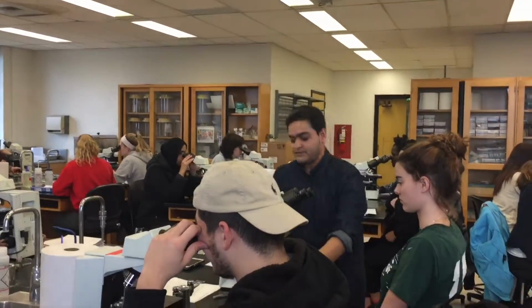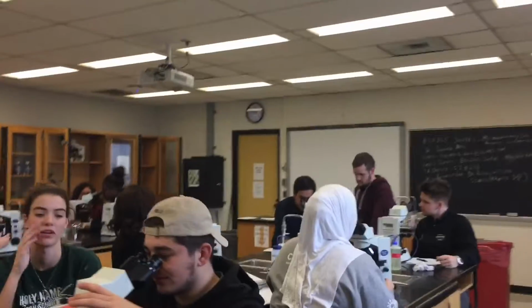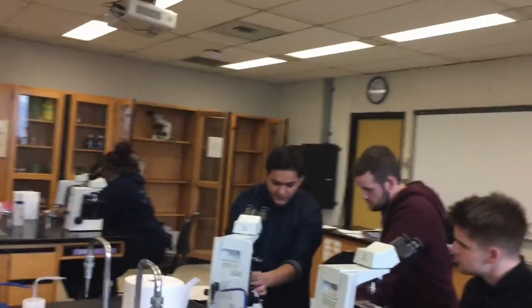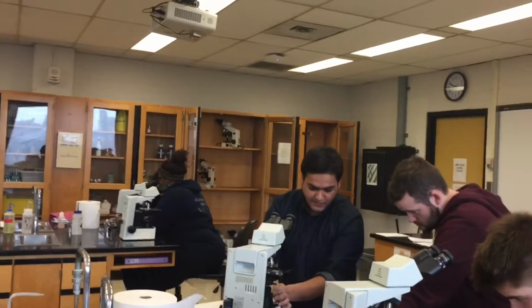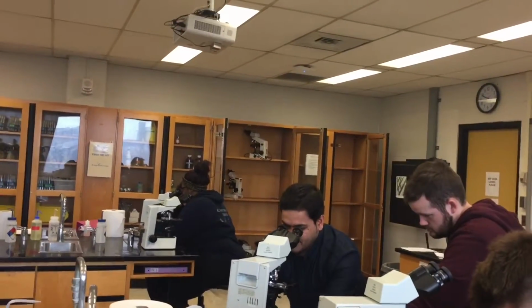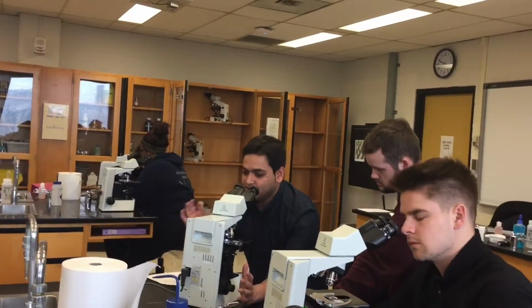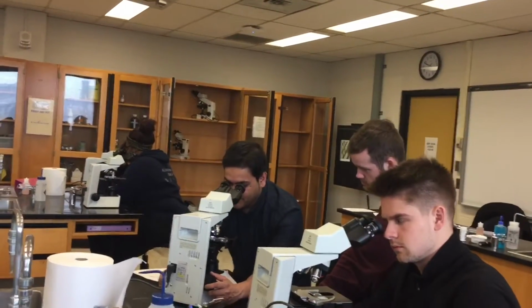Okay, cool. Good job. Okay, go back to the one and find it. So make sure this slot is sitting properly. Open this one all the way. This one shouldn't be like this. It should be open all the way. Then I keep my eyes there. I try to look for colored tiny spots or something.